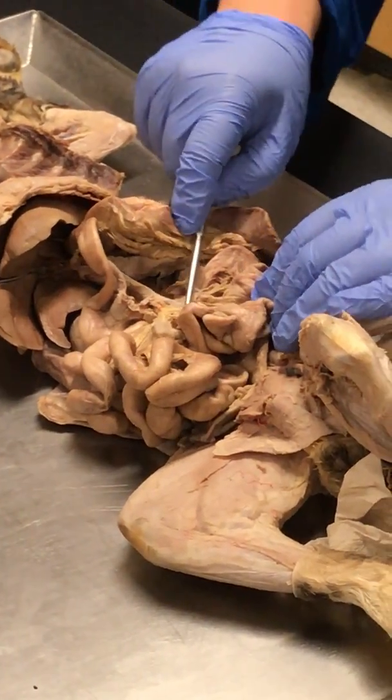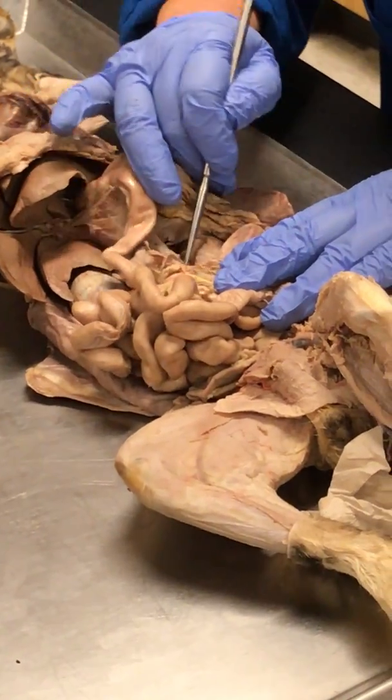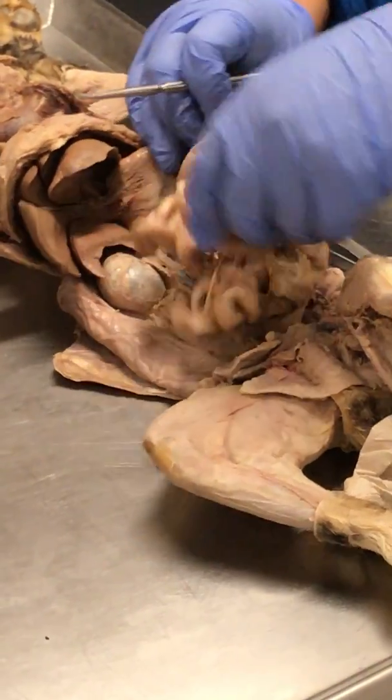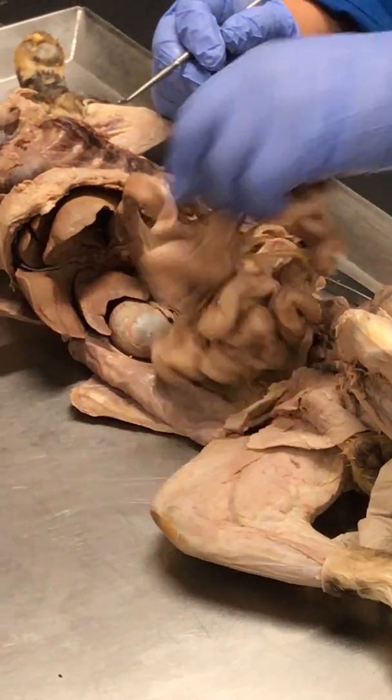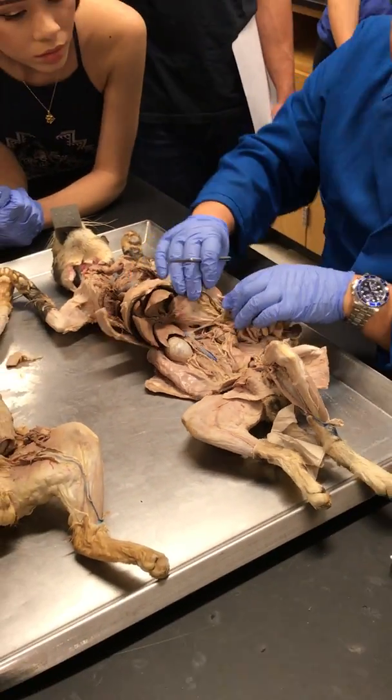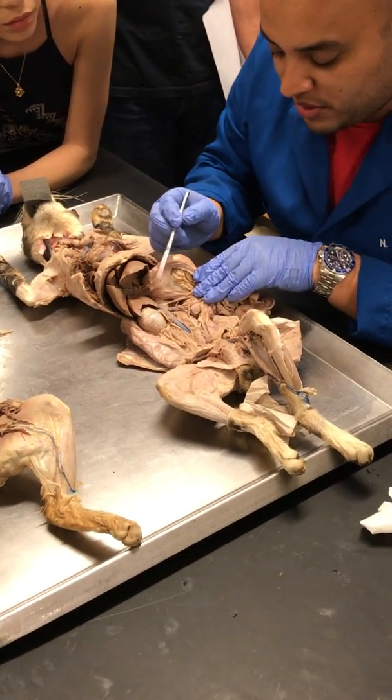That looks like the inferior mesenteric vein, but again, I can't really tell with this cat. It's not prepped so well. So for the veins, either a model or I'll pick a really good cat that has it very nice. I did show you guys, right? Last week? Okay, so there's no worry with that.